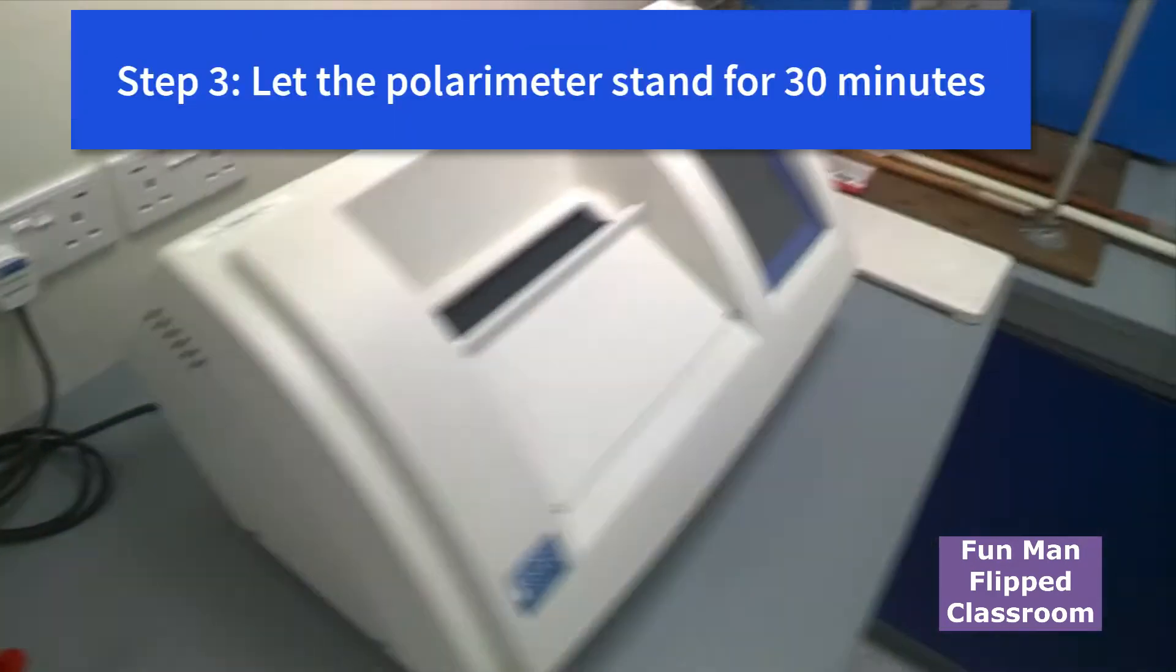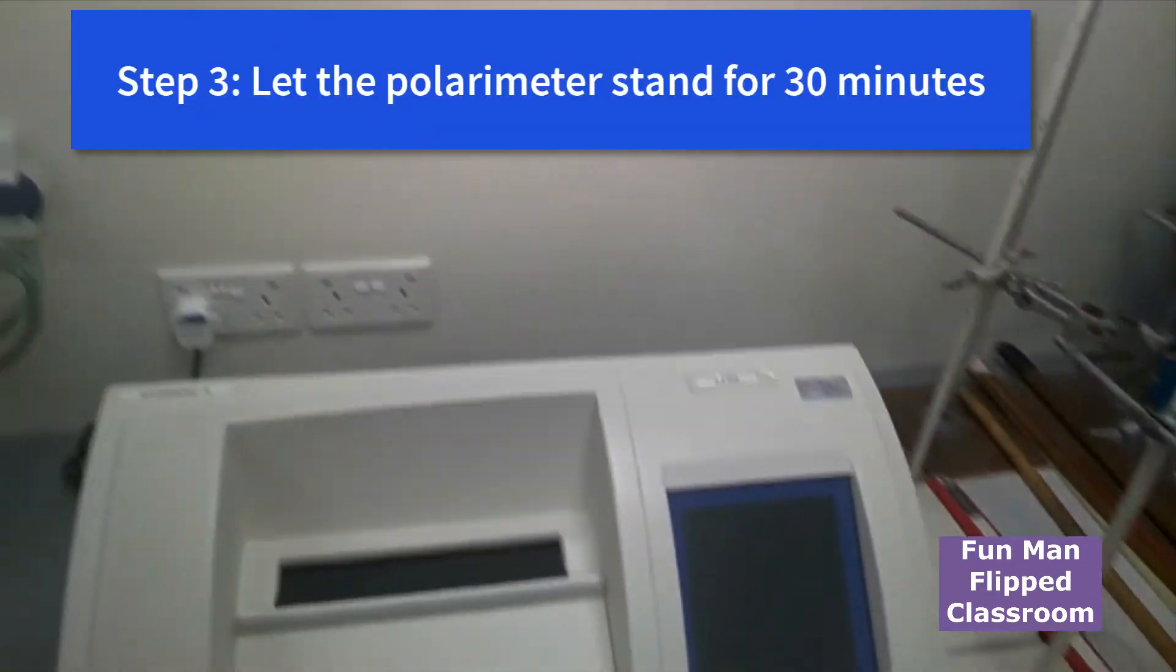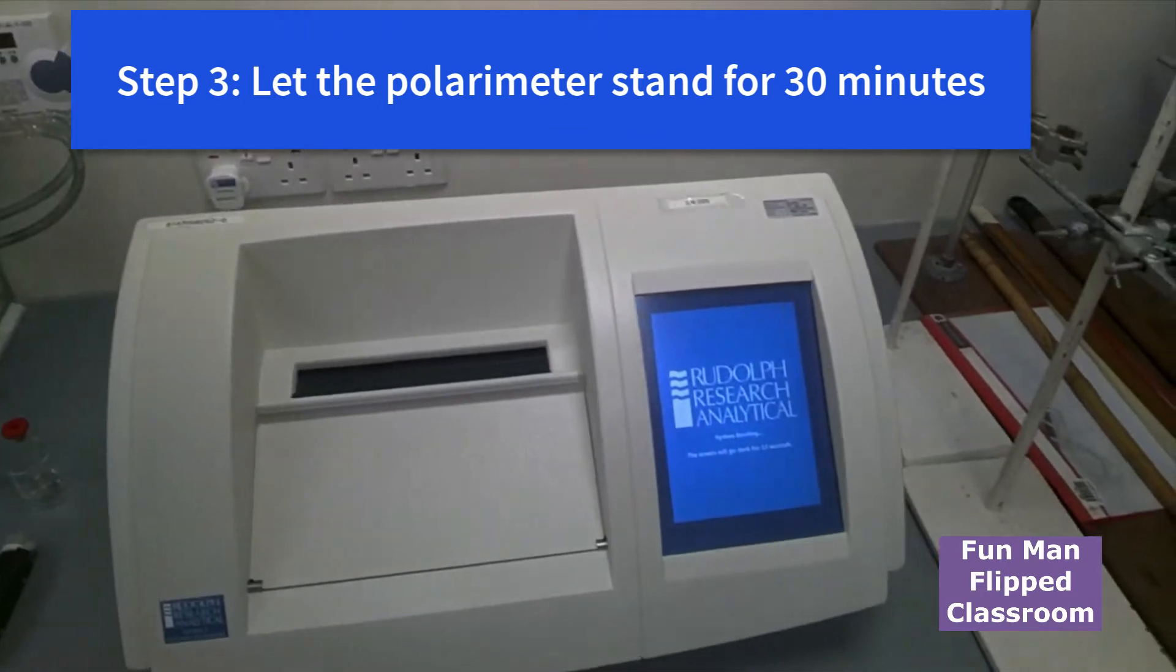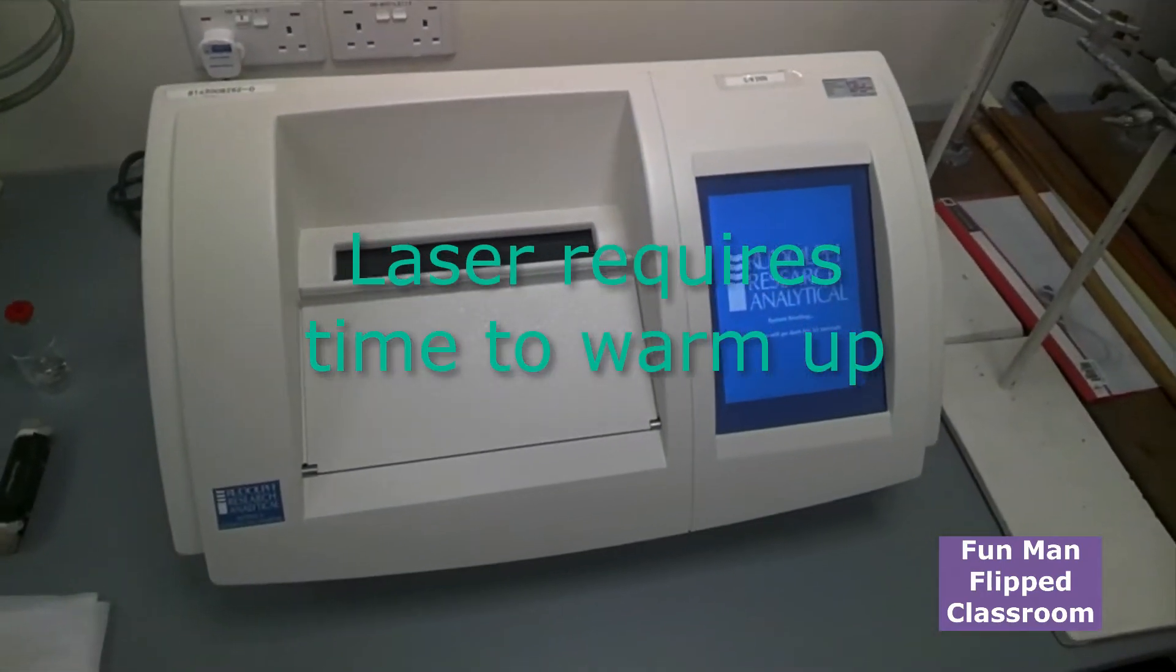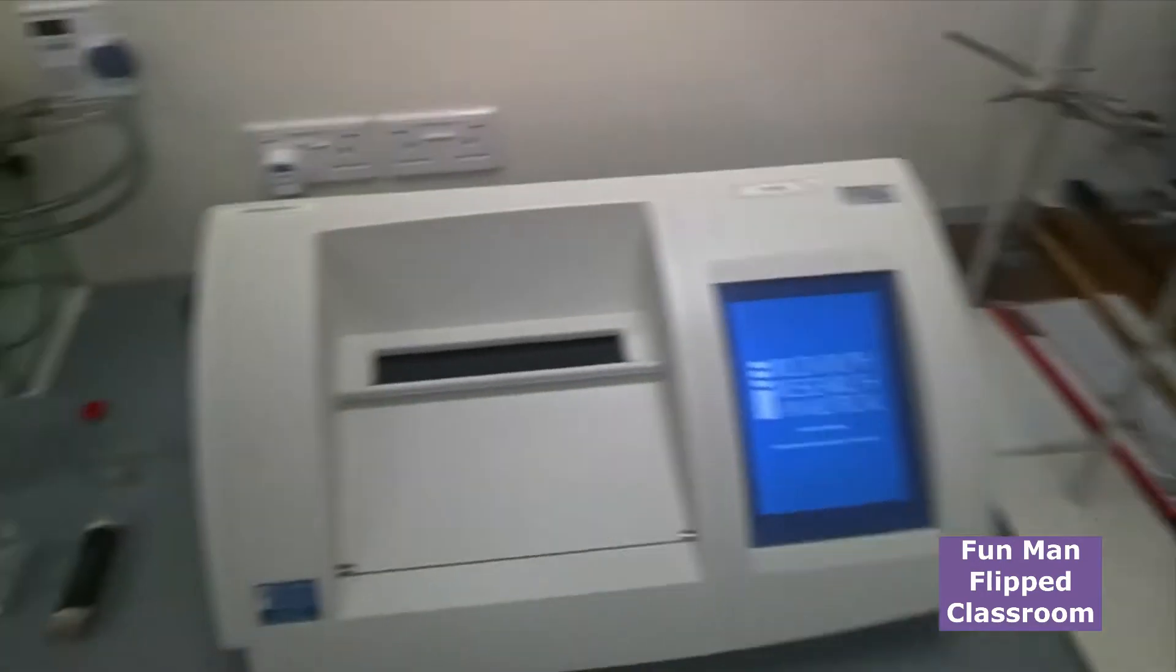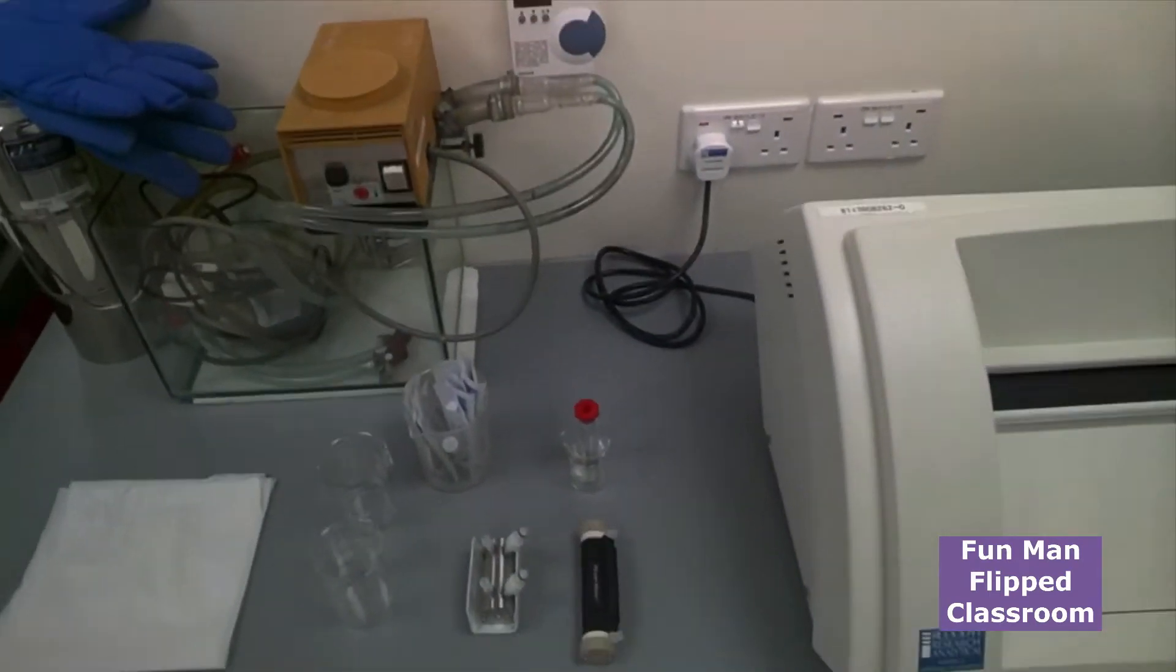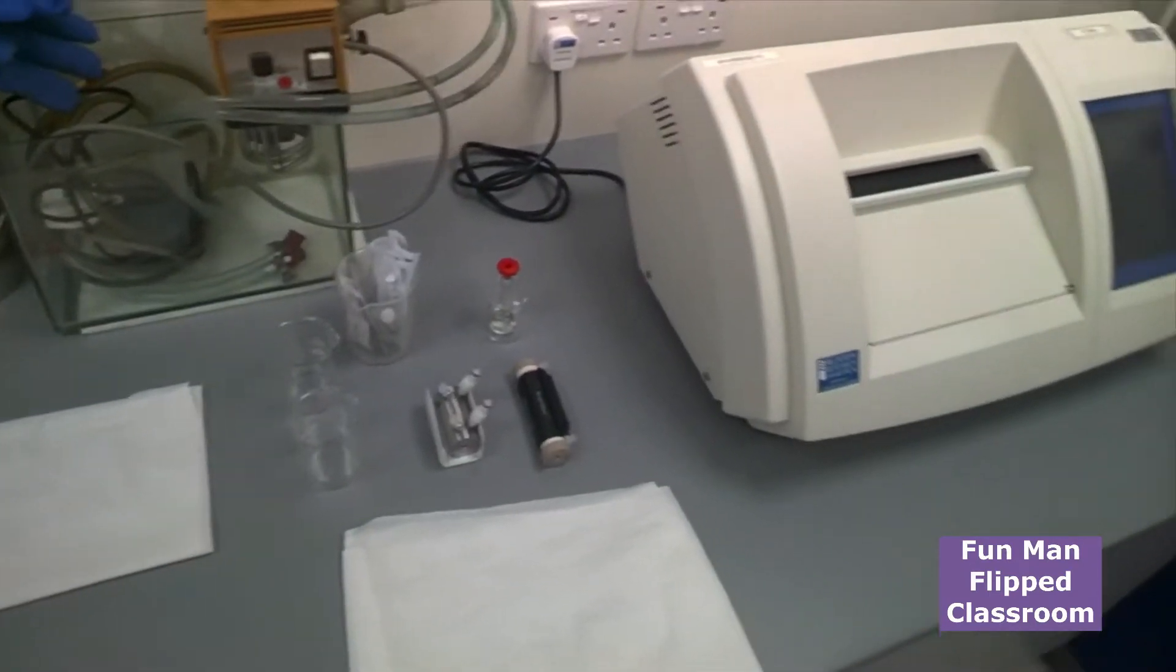Hear the sound? Alright. Now this polarimeter, you have to let it stand for about half an hour to warm up. Why is that so? Because we're using laser, and the laser lamp needs to warm up first. If not, it won't be a stable reading. So meanwhile, I'll just guide you what are the other apparatus you need for this experiment.